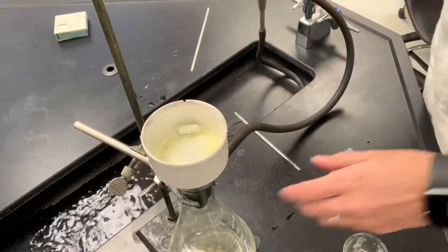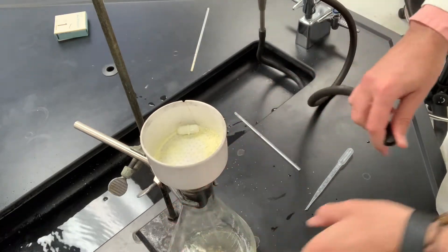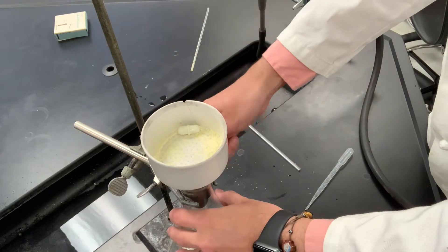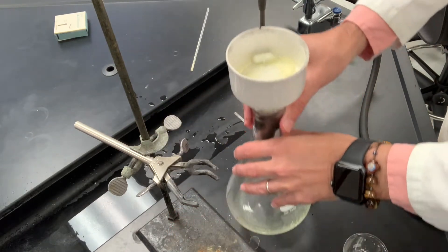Five minutes later, we'll go ahead and break the vacuum by disconnecting this sidearm. We will just set this aside, so I'll put a label on it so I don't forget which reaction it is.